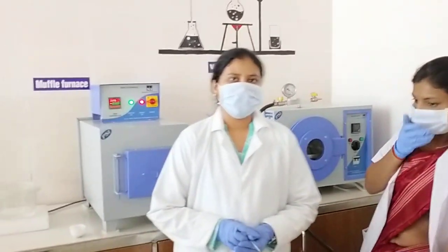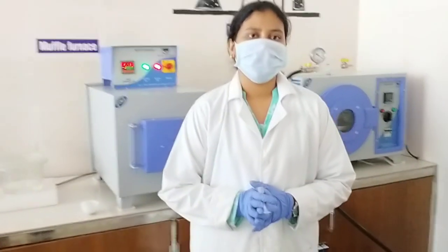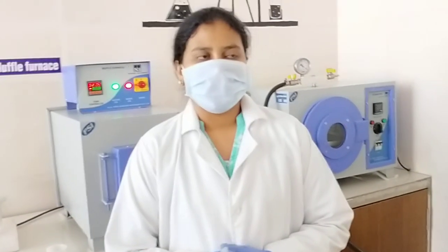The method needs care, so you follow safety rules like wearing gloves, mask, etc.